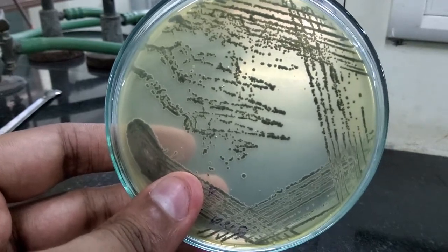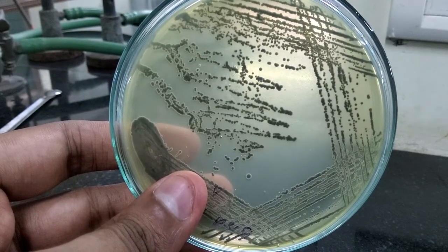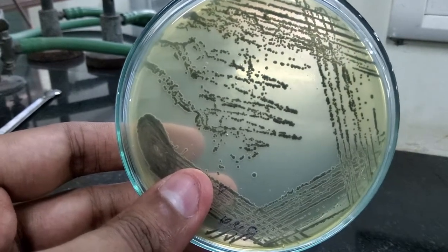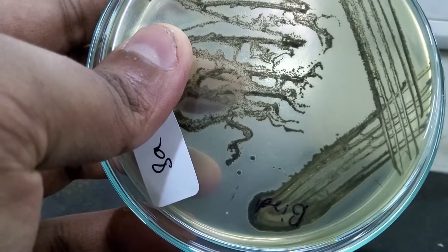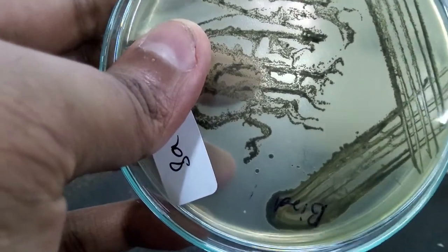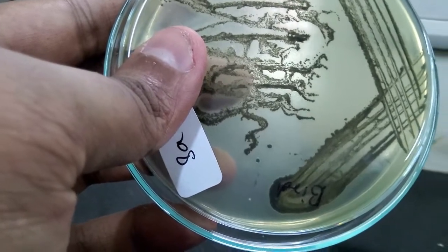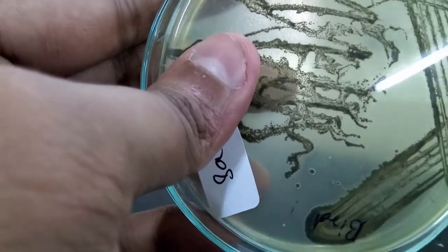I have another plate which I will show you for the clearance — this one is 48 hours old — and you will see how the clearance is seen more evidently after 48 hours of incubation. If you observe this plate carefully, you will see that around the colonies there is a slight halo appearance, and beyond that halo you can see slight clearance, especially around the edges where the inoculation was done.